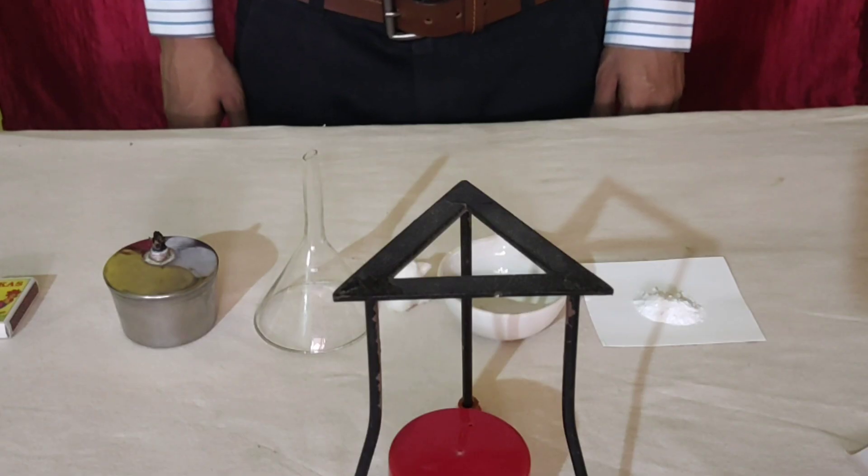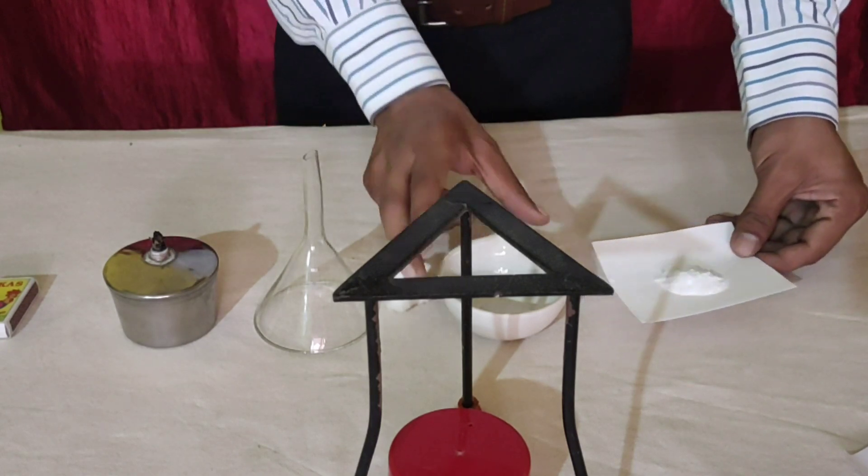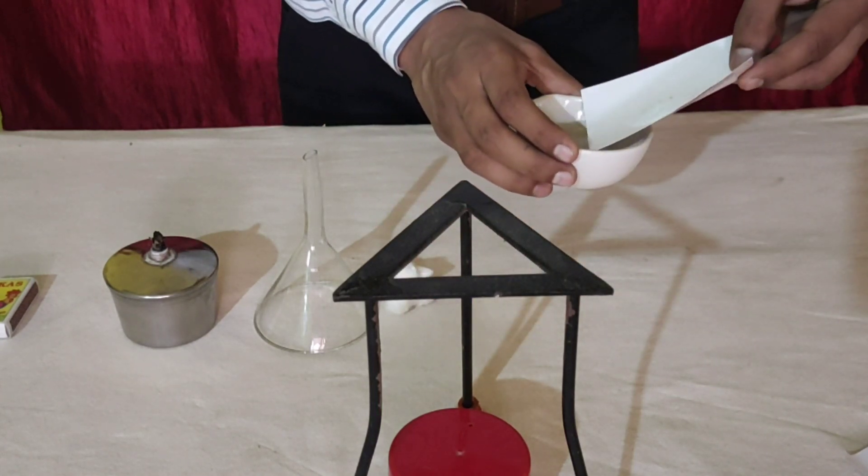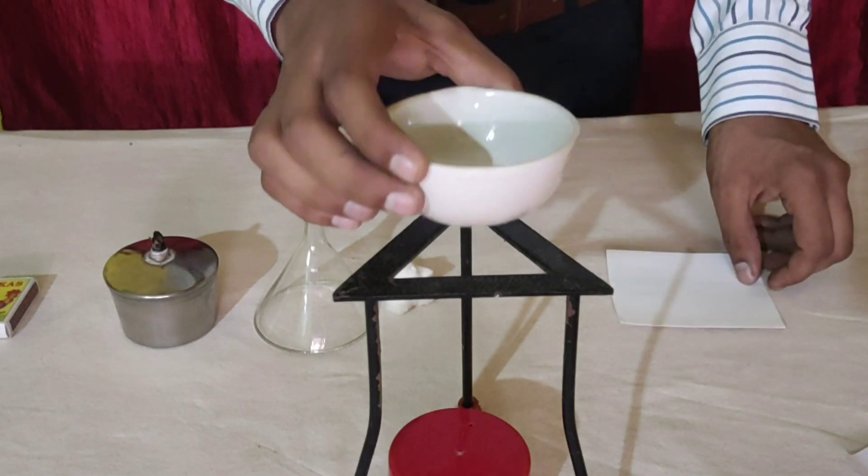How will you proceed? Take crushed camphor in a clean and dry china dish and place it on the tripod.